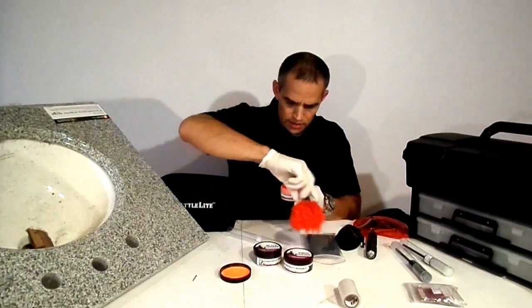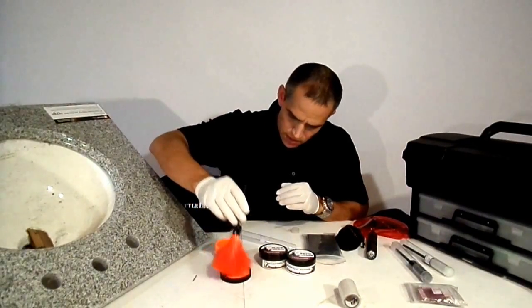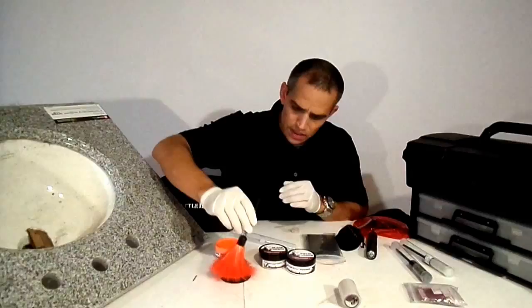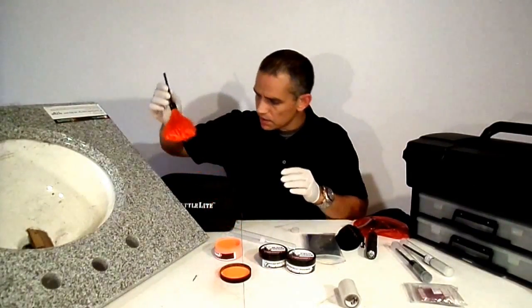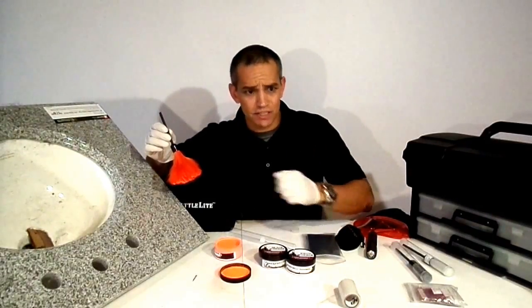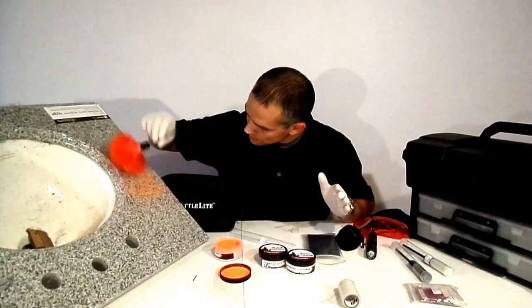Oh, look at that — it's brilliant! So we're going to take that orange powder. Now we just need just a little bit. Remember: more details, less powder. If you go ahead and develop that and you're jamming that brush in there, you're going to get terrible prints. So we're going to go ahead and dust this up.